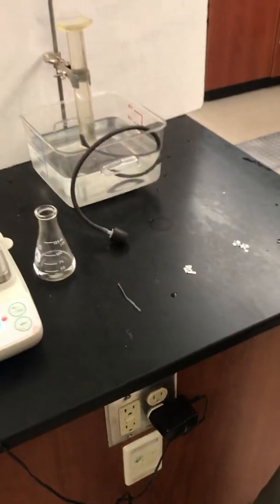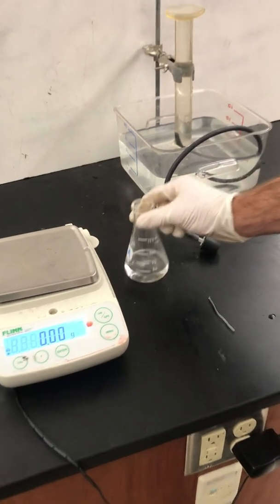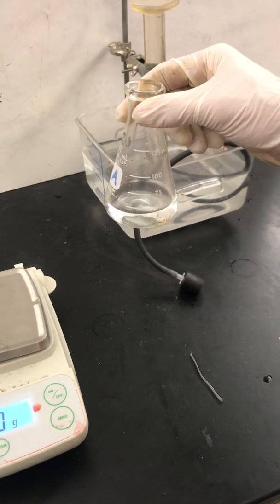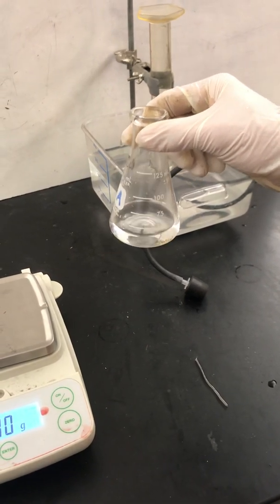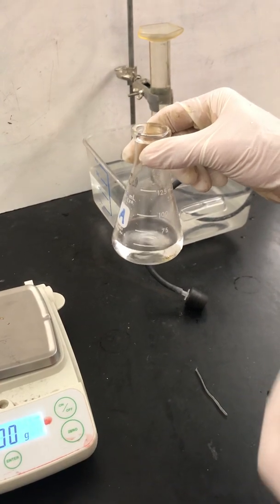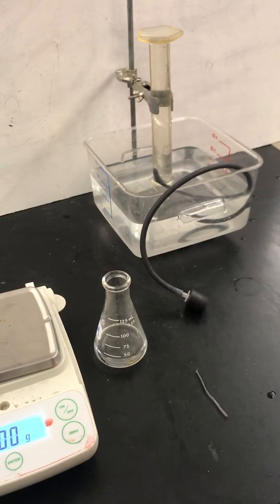Another option is that you could manipulate the concentration of the hydrochloric acid. Here's a flask with hydrochloric acid in it. You could have this at 3 different concentrations, and that would be manipulating the concentration of hydrochloric acid. If you were to do that, you would want to have the volume or amount of hydrochloric acid the same, and then the same mass and surface area of magnesium.